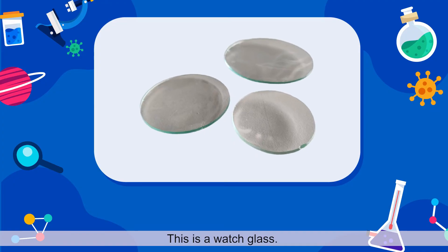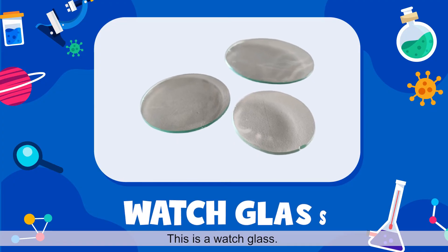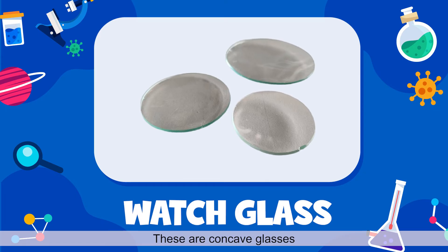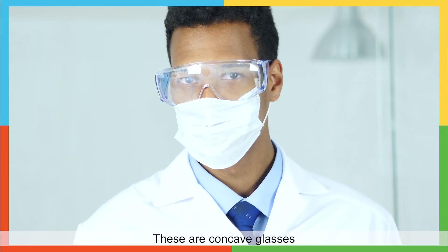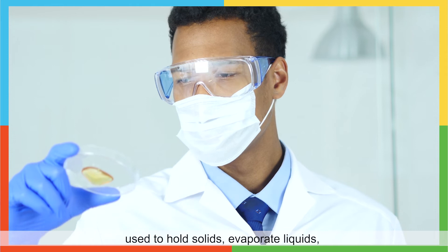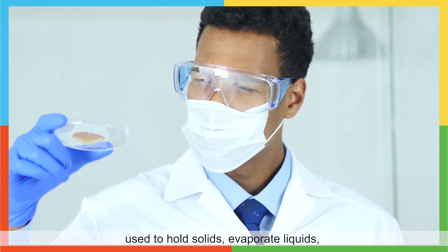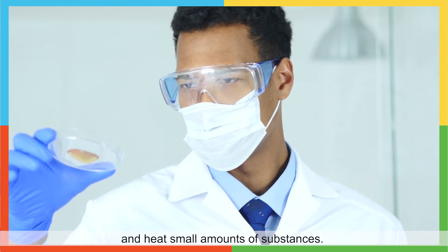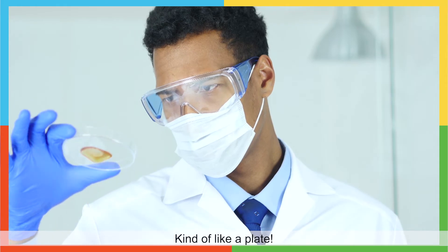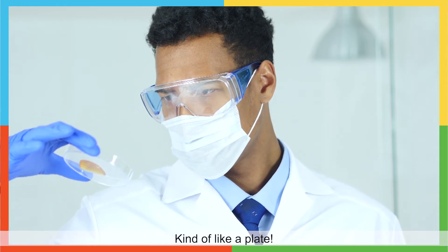This is a watch glass. These are concave glasses used to hold solids, evaporate liquids, and heat small amounts of substances — kind of like a plate.